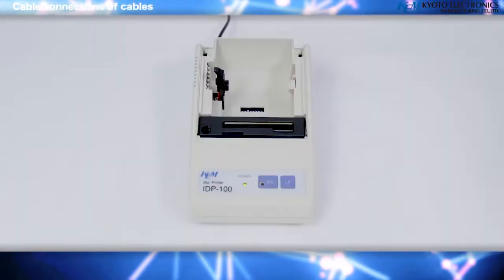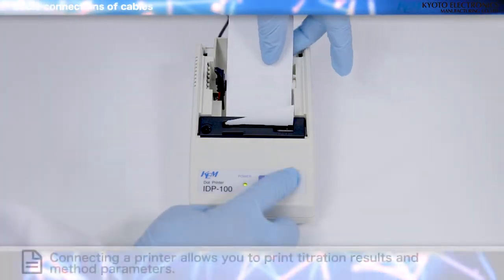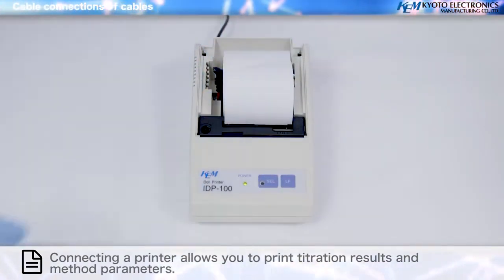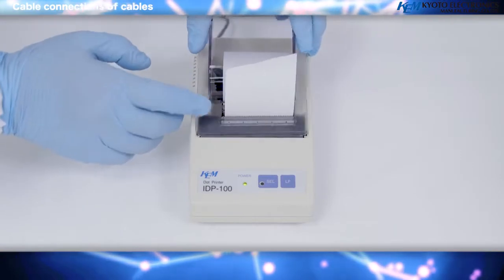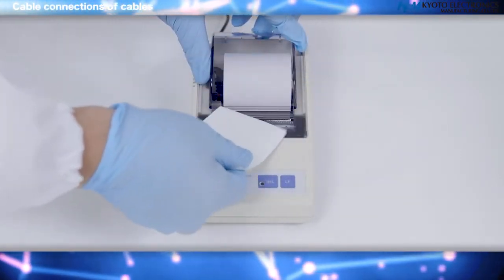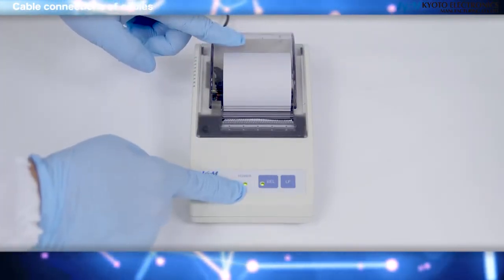Printer connection. Connecting a printer allows you to print titration results and method parameters. Load the paper. When the paper is cut on an angle, it is easier to feed. Turn on the power switch.